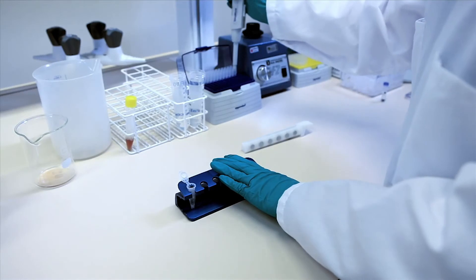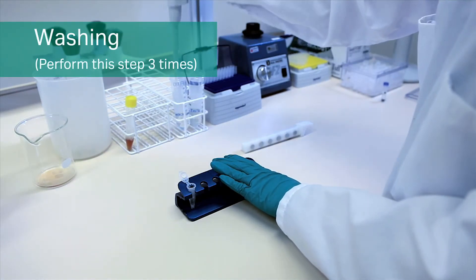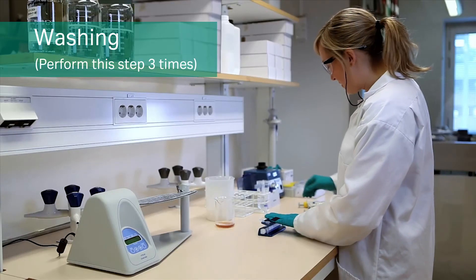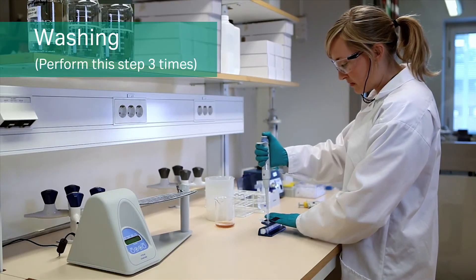Add 500 microliters of binding buffer with 5 to 60 millimolar imidazole to remove unbound proteins. Repeat this step three times.